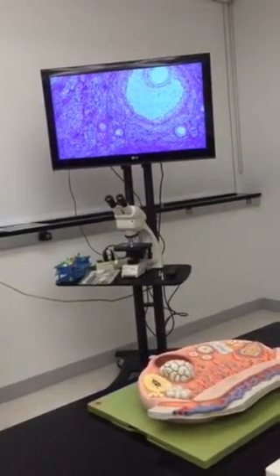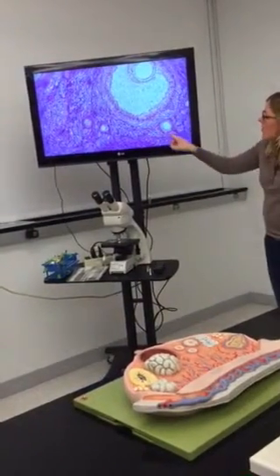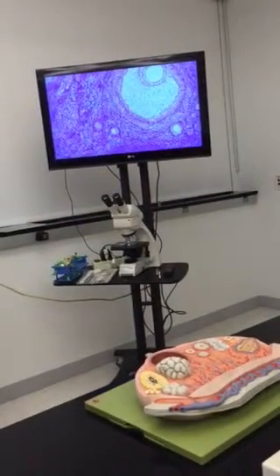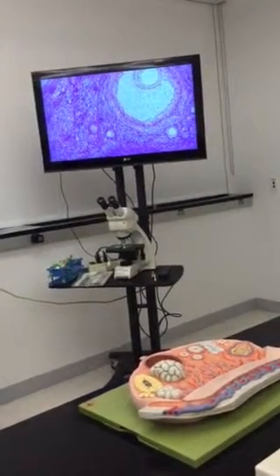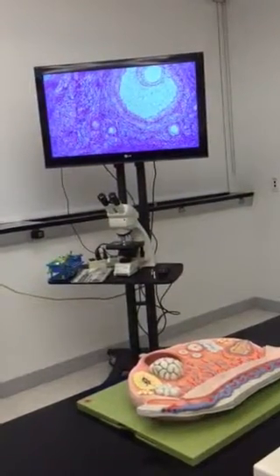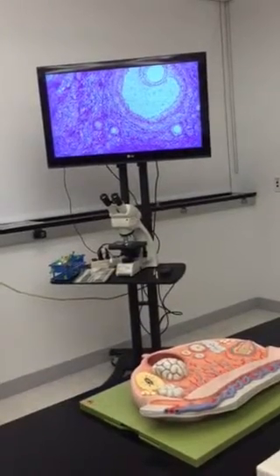So there'll be a lot more cuboidal layers with the secondary, a lot more than this. Okay? So it'll be bigger, and between those cuboidal cells, you'll start to see fluid-filled spaces form. But it won't be a big one like in the graafian follicle. So I'm going to look and see if I can find a slide that has some secondary on it. Okay? But this one is not. Yeah, the one in the lab had only the primaries.